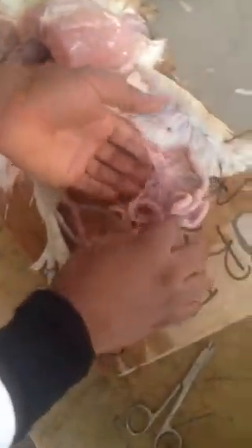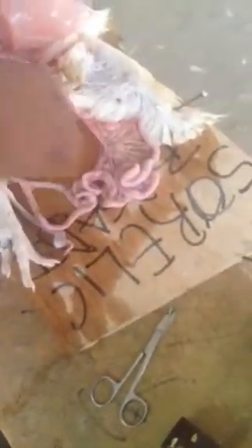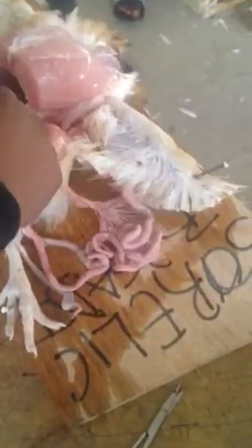These particular mesenteries, what do you do? Diverticuli, since this one is too big, you can put them like this. Your mesenteries here should be showing. This is your small intestine. From your small intestine, you have what? This area now will be what? The duodenum, the first part of the small intestine called duodenum.